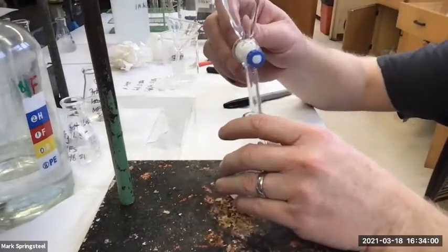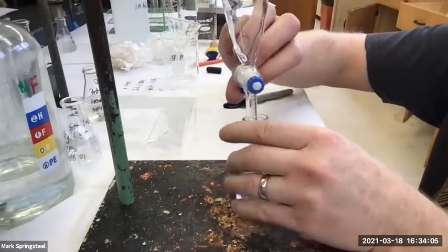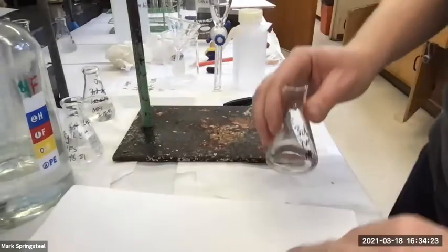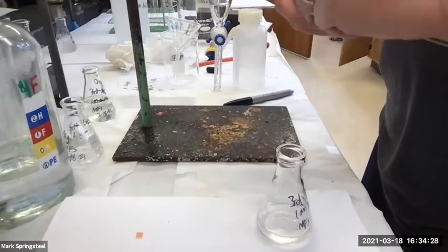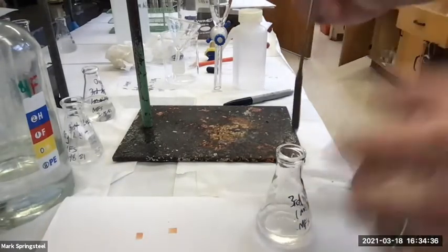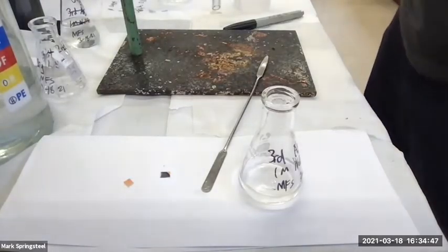Okay, so what should this be, acidic or basic? Should be basic. Yeah. And you notice I keep checking the pH with the pH paper even when it's obvious. It's a good idea to do obvious stuff like this because it's nice to find a mistake right away. So I'm still going to check this even though I'm 99% sure it's all good. Should be basic. It's basic. Good. Okay. And now what do I do to it to look for precipitate?